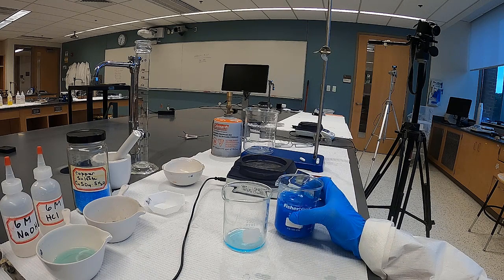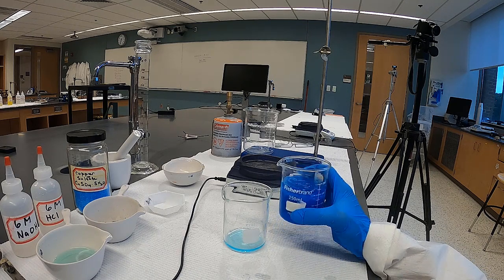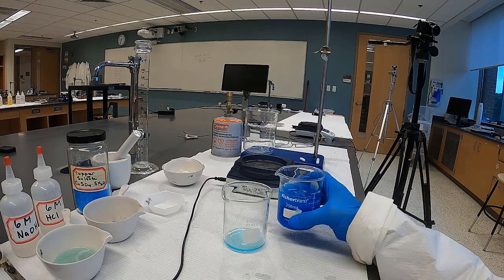And it's very challenging. It is very challenging to really decant this.